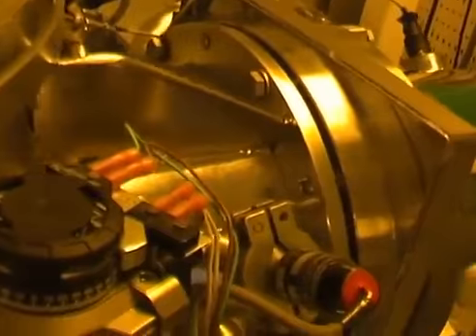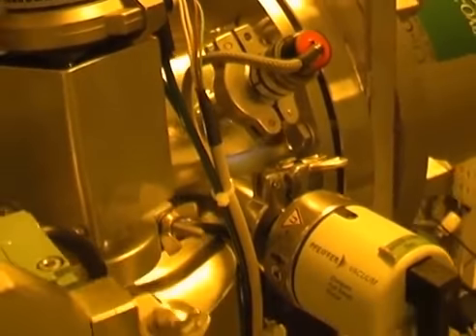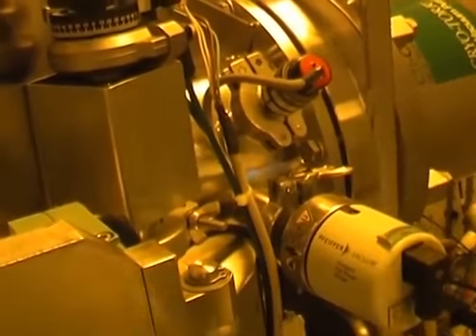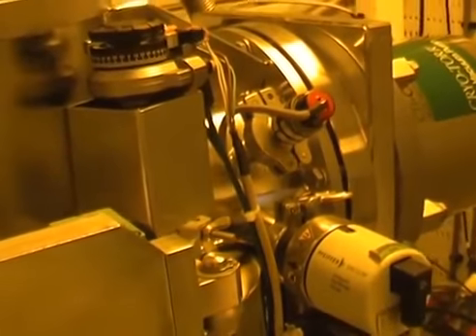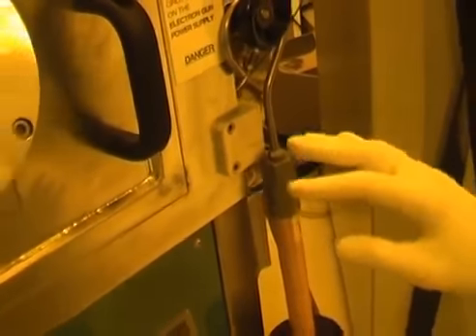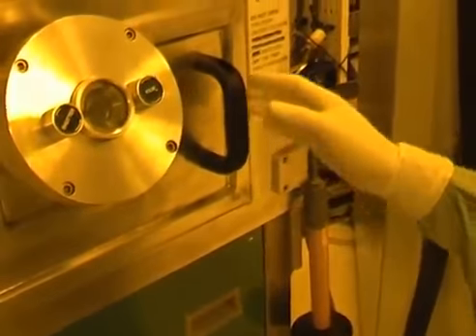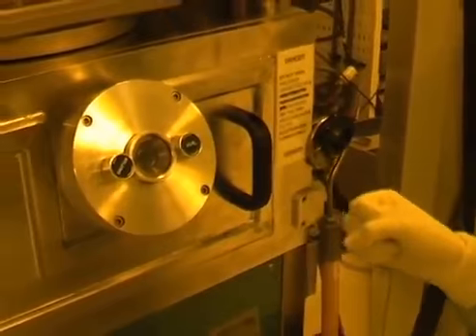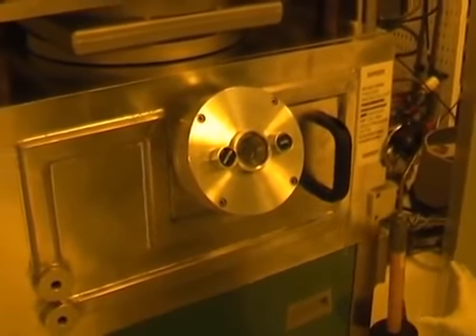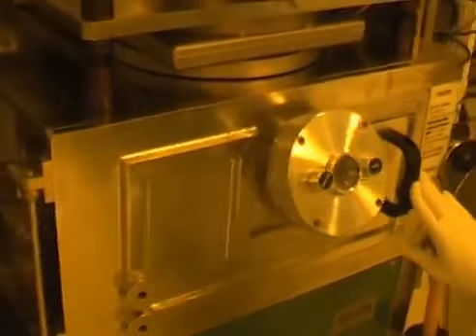So these are the electronics, and these are the gauges. Leave this part alone, don't come close to this area, because there's no need to; only the technical staff will. And here there's an earthing rod. Again, you won't need to use this because it is used only by the technical staff whenever, for maintenance, they have to open the main chamber, and they put the main chamber to ground before doing any operation to be touched.